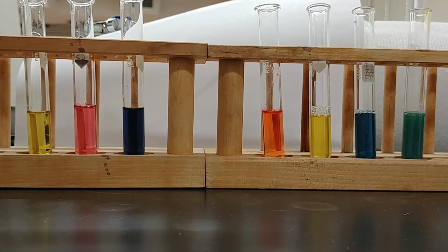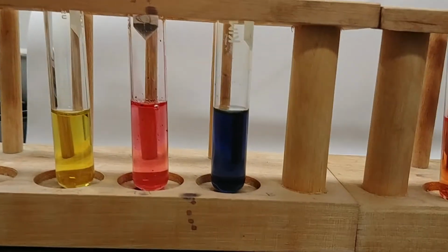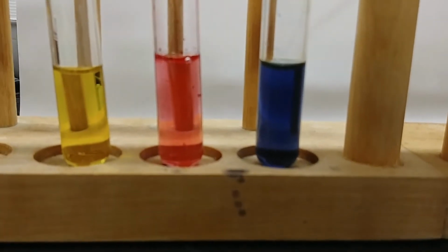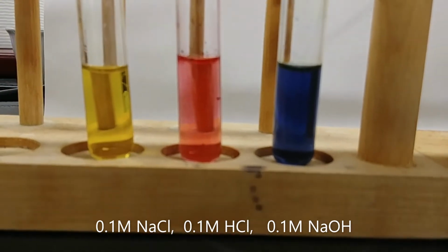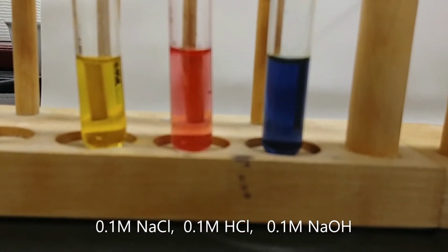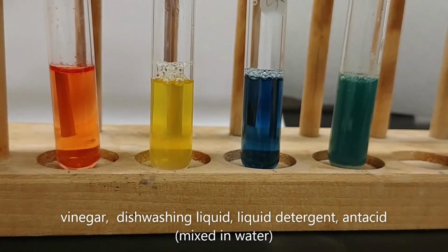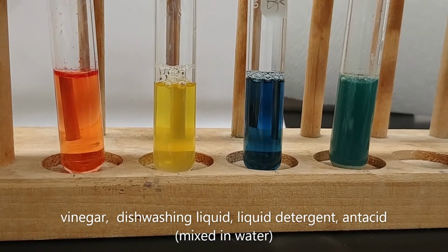So do your best to try and gauge what the pH of each of these solutions is based off of what color you see. Again, these are in order: the sodium chloride from left to right, sodium chloride, hydrochloric acid, sodium hydroxide, and then over here we have vinegar, dishwashing liquid, liquid detergent, and the antacid.